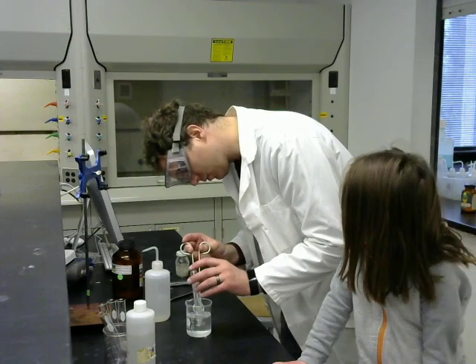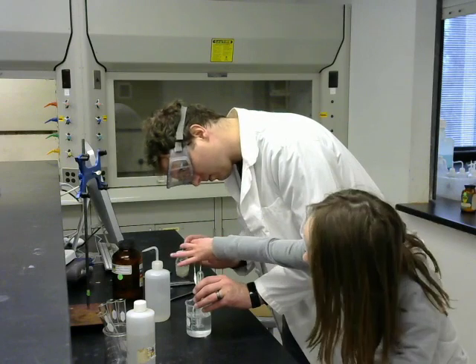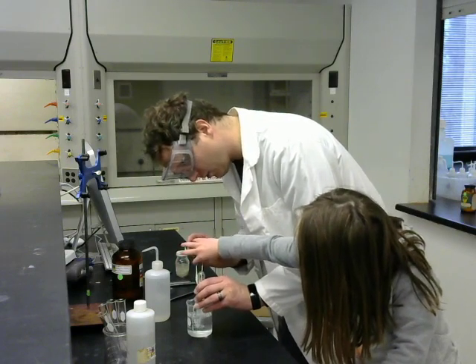And we will soon test them to see if they are going to be flammable like the bubbles from before.